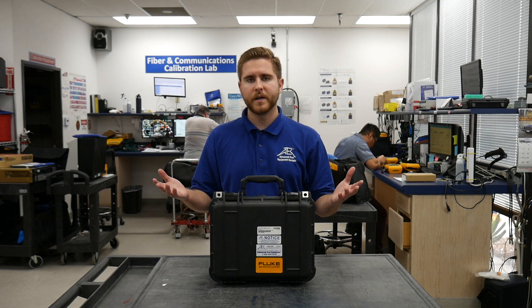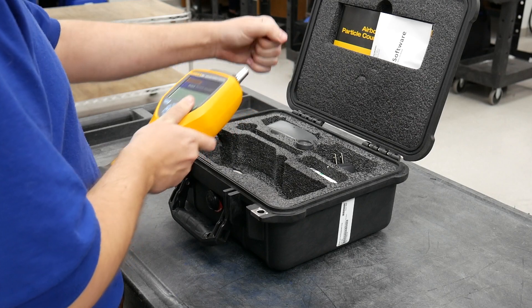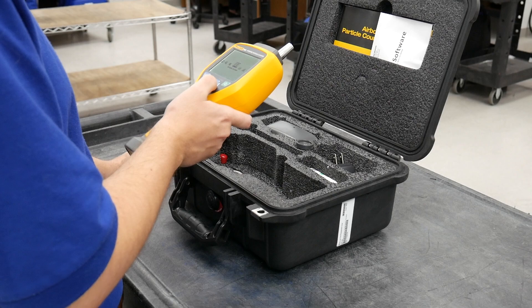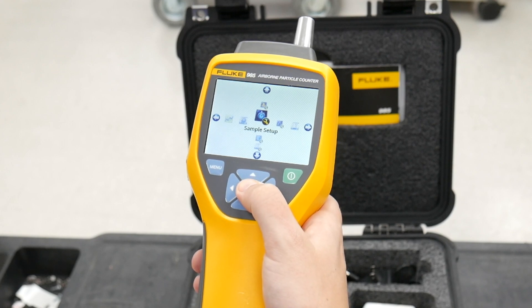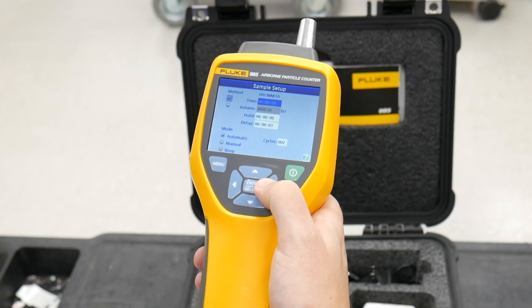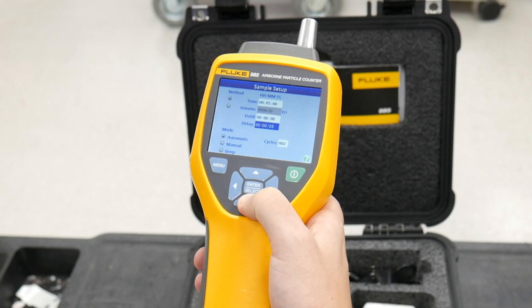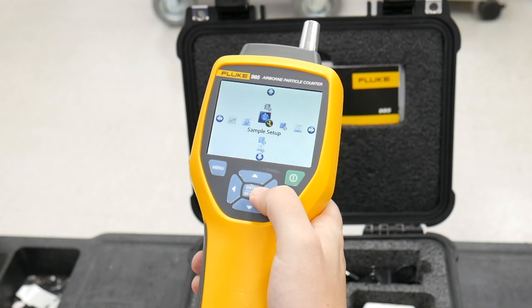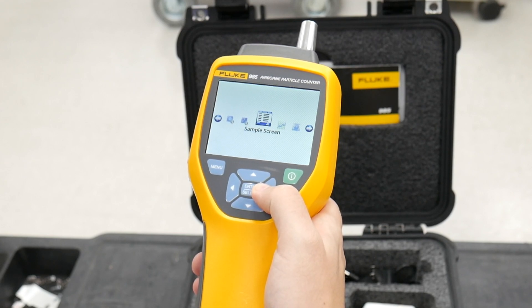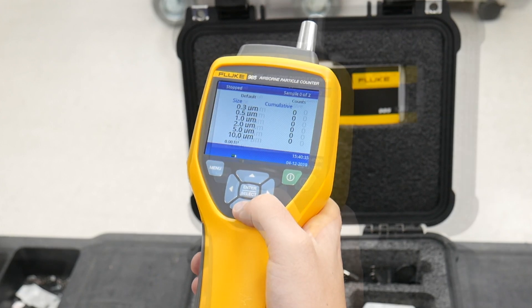First, here in an uncontrolled environment in our lab, and then in a controlled environment, our clean room. Here we have the Fluke 985 — let's turn it on and remove our cap. We're going to start by setting up the 985 at the sample setup screen. You want to make sure that your time is at five minutes, your hold is at zero, your delay is at three seconds, that you're in automatic mode, and that you have it set to two cycles. Now this is for a standard test, as a trial to demonstrate what your average particle count is in a normal environment like this lab.